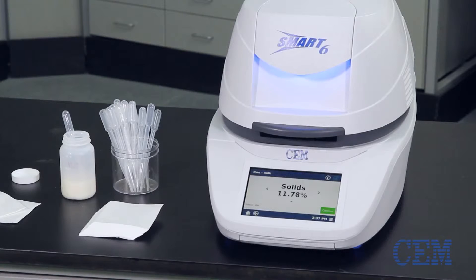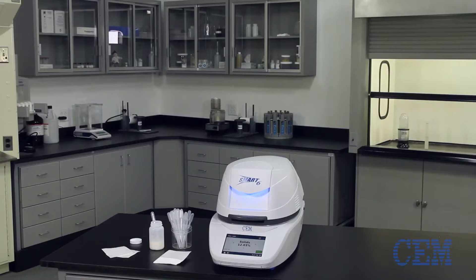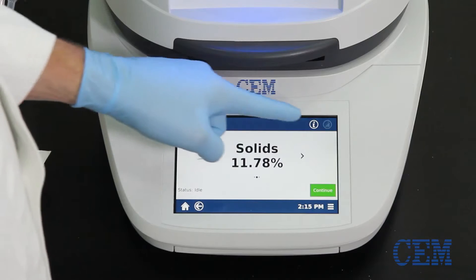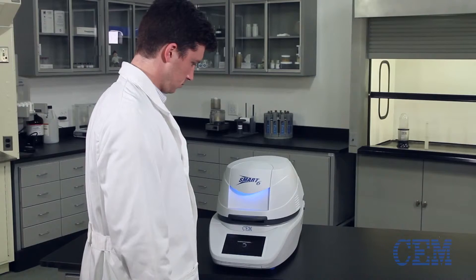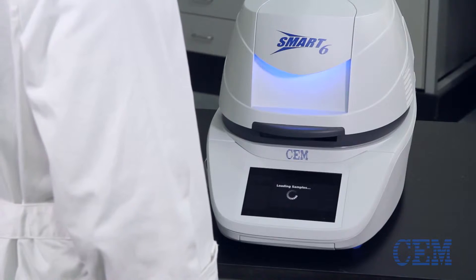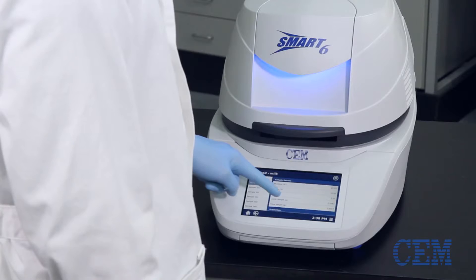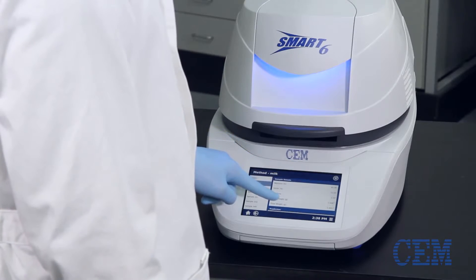After completing a test, you can quickly review information for that run, such as final results, run time, and initial weight, by pressing the I button at the top right corner. Up to 999 previous results for the current method can be displayed and recalled. Results can also be sent to a LIMS network for easy data management.